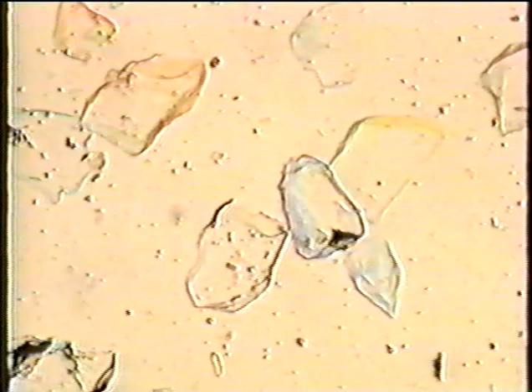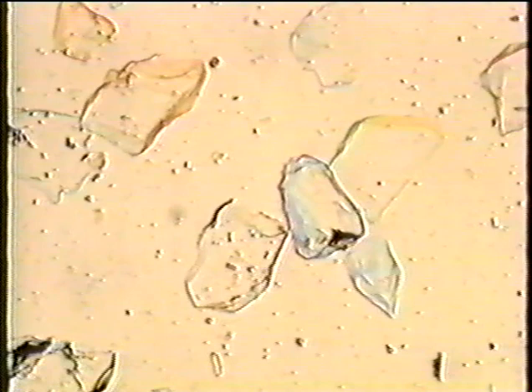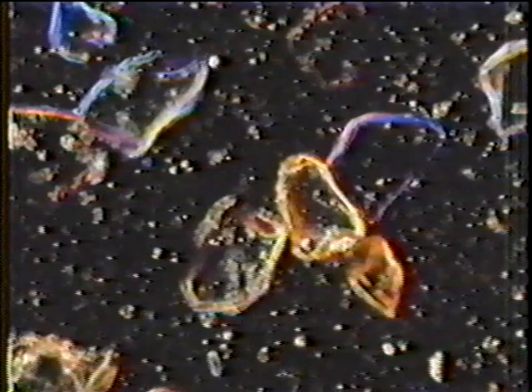Here we see our olivine crystals with annular stop. Particle boundaries are colored, and you should note a few of the particles — the green one, the blue one, the orange-red one in the upper left — and we'll see how they appear when we switch to the central stop. The field is bright with the annular stop, but will be black with the central stop. The colors we see for a given particle depend on the refractive indices of that particle, its dispersion of index, and the dispersion of index for the mounting liquid.